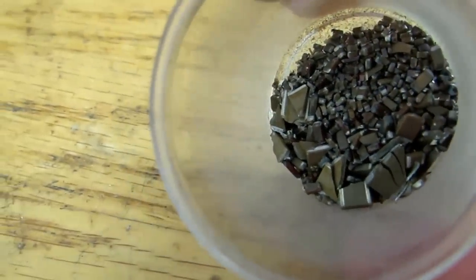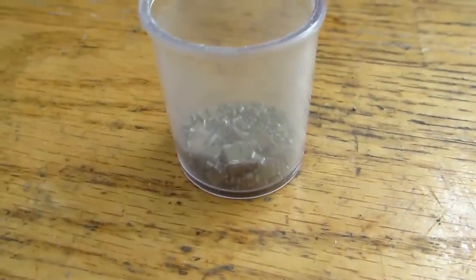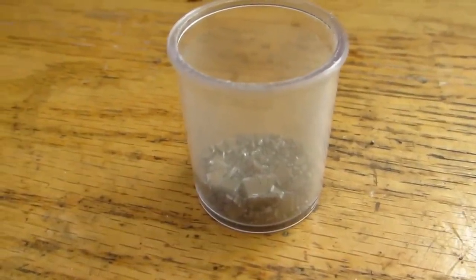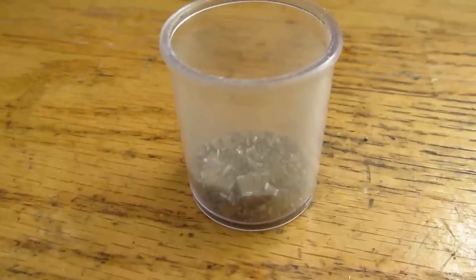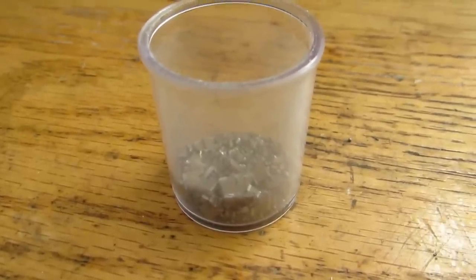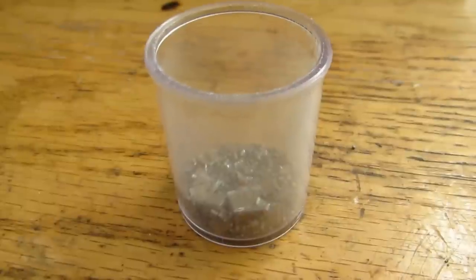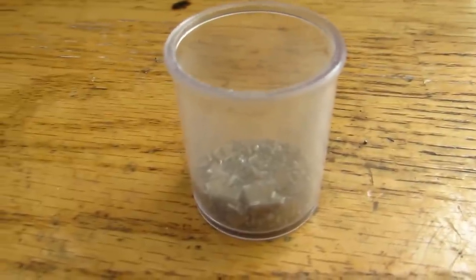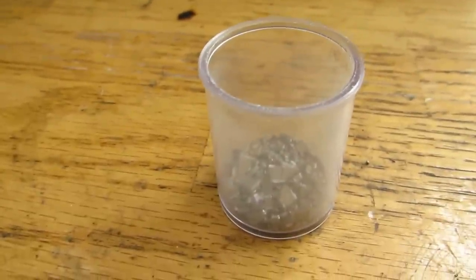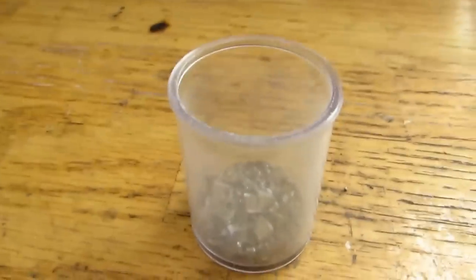I did find some that were gray on there that said that they were capacitors, but they're not monolithic ceramic capacitors, because they're identified by their brownish to tan color. So anyhow, you can see there were some quite large ones in there, as well as some really teeny ones. But basically what we're going to do is dissolve off all of the nickel in some hydrochloric acid. Now, keep in mind that hydrochloric acid when dissolving nickel creates nickel chloride, which is actually carcinogenic. So be very careful while you're doing this, and don't ingest or inhale any of the nickel chloride. I highly suggest that you do not boil down your solution of hydrochloric acid and nickel chloride afterwards, as the pure nickel chloride salts would not be nice to deal with, due to their cancer-causing abilities.